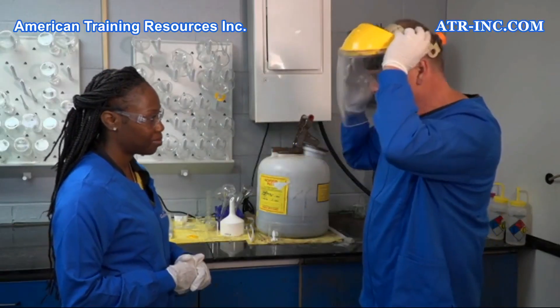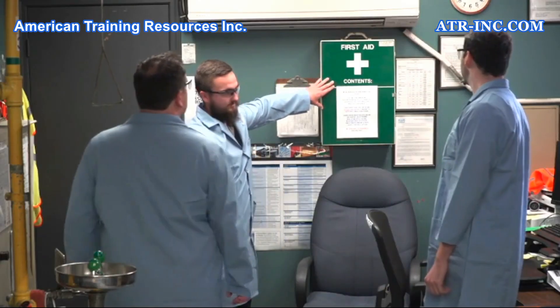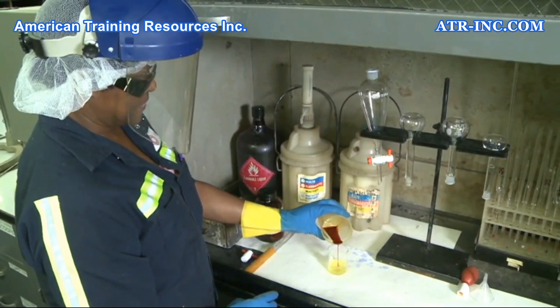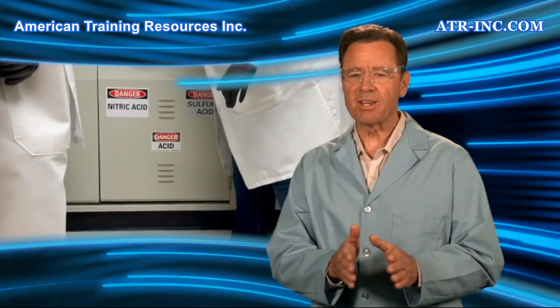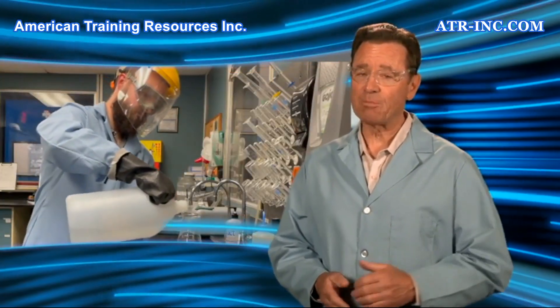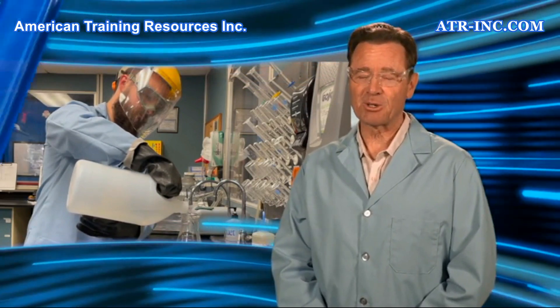To prevent injuries and incidents, laboratory safety must be top of mind for all laboratory workers and their employers. In this program, we will discuss some common laboratory hazards and learn about the safe work practices and procedures that may be used to control hazards and prevent injuries to laboratory workers. Let's get started.